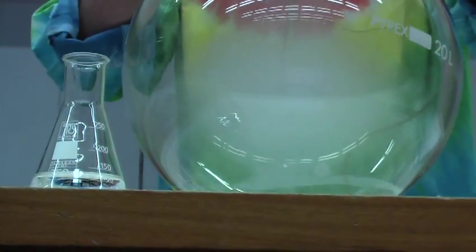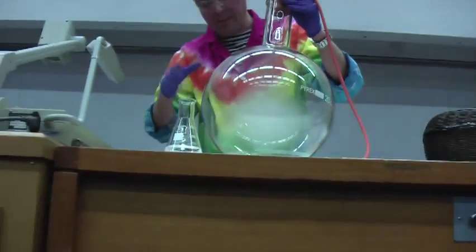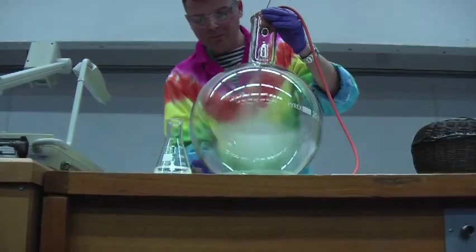We could have used just an oxygen cylinder, but what's the point? It's nice that you can see that little novelty item, which you probably won't see again unless you get someone as dumb as me to come and do a lecture for you. There it is. Now we're going to let that all evaporate away nicely.